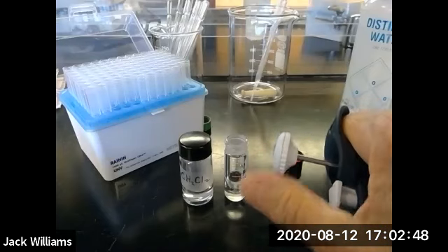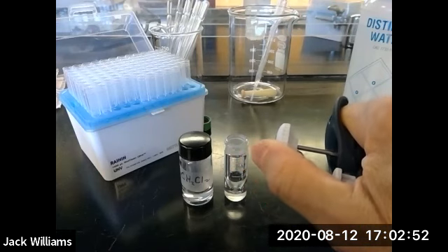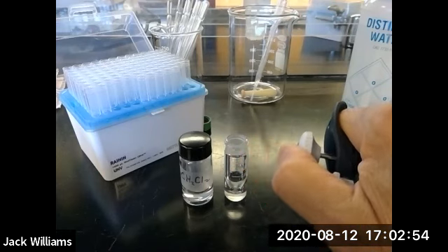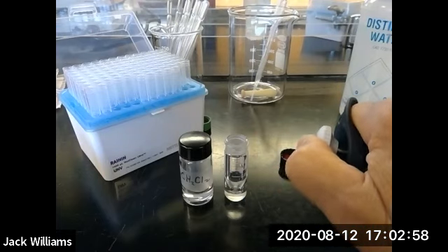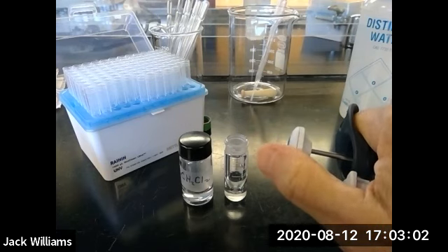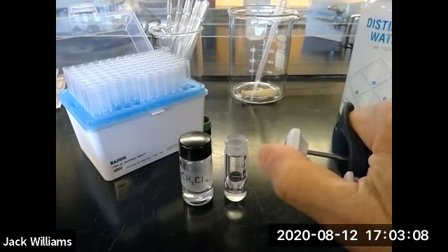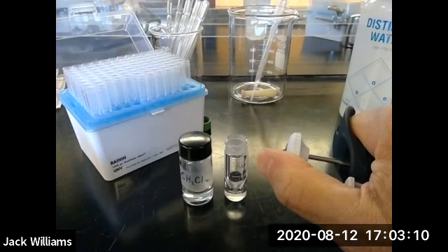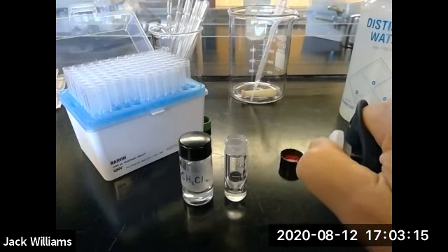When you dispense the liquid out of the tip, you're going to reverse the motion down to here, and then for that little extra drop that may be in the tip, you go down to the second stop. So again, to aspirate, that is to withdraw into the tip, first stop, draw it into the tip. To dispense it from the tip, first stop and second stop.